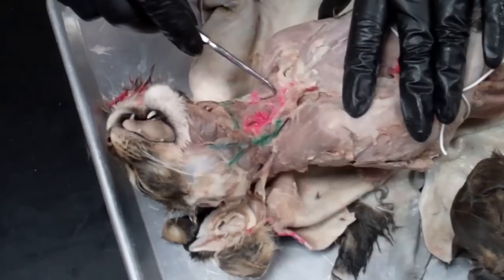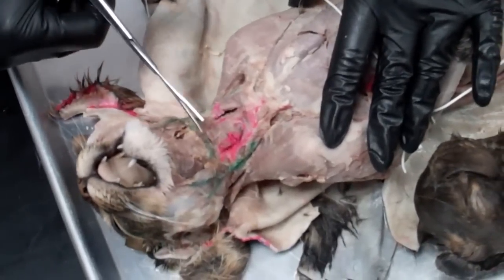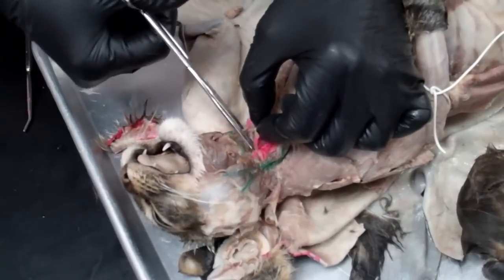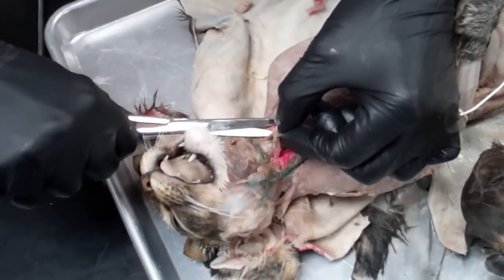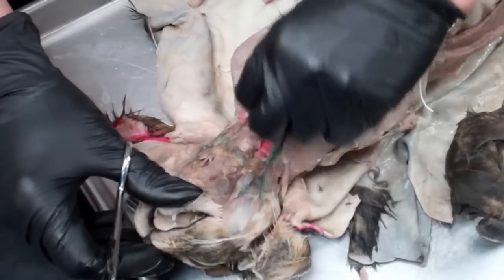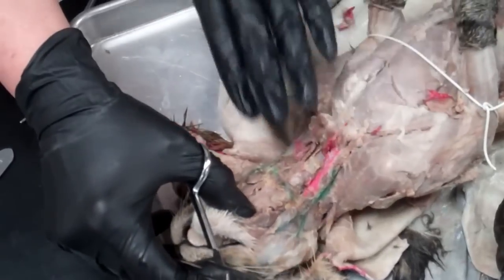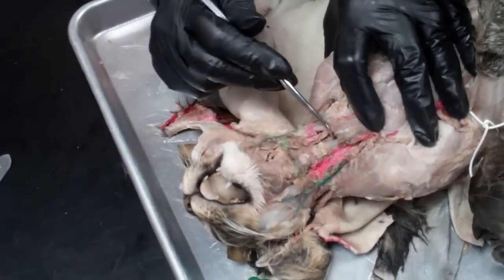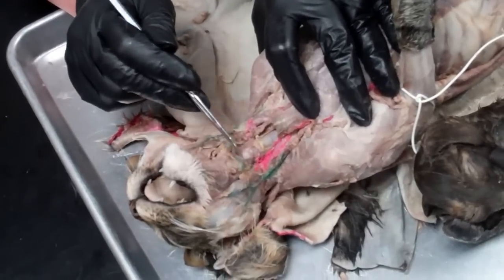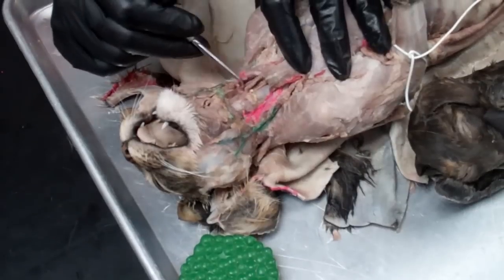In the middle we have a muscle called the sternohyoid, and we're going to be cutting that at the top and going down deep enough to find the larynx and the trachea. It's connected to the trachea by some fascia material, but you're going to want to cut and reflect that. Now you can see inside — these are the rings around the trachea right here, and the top part here is the larynx.